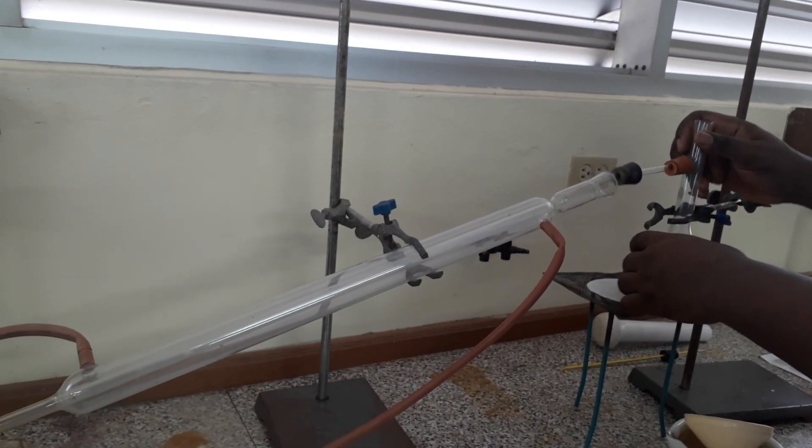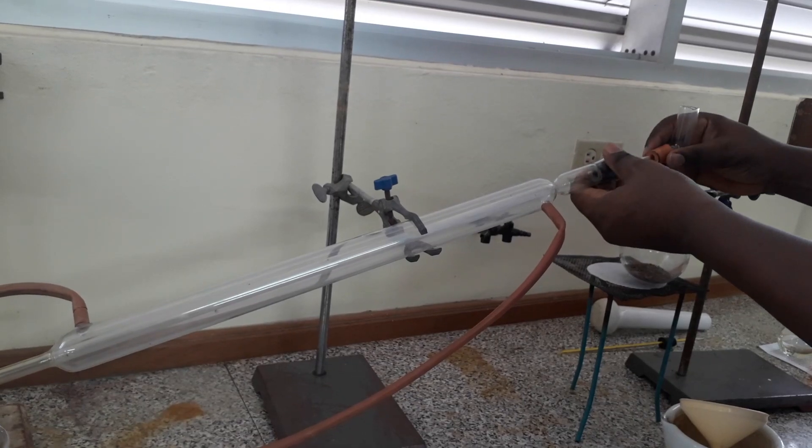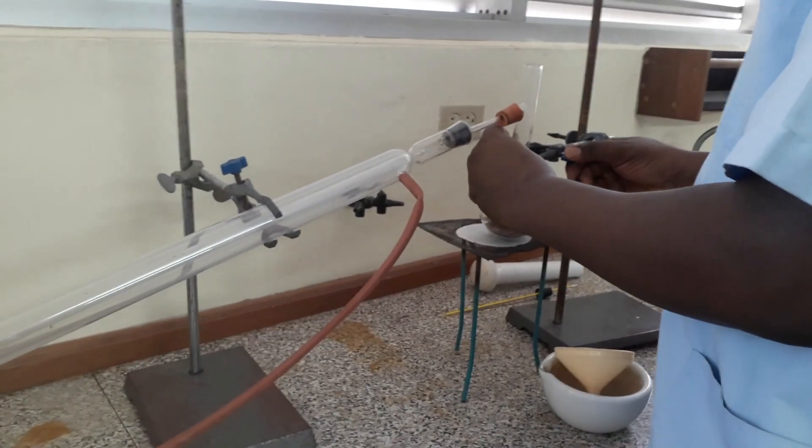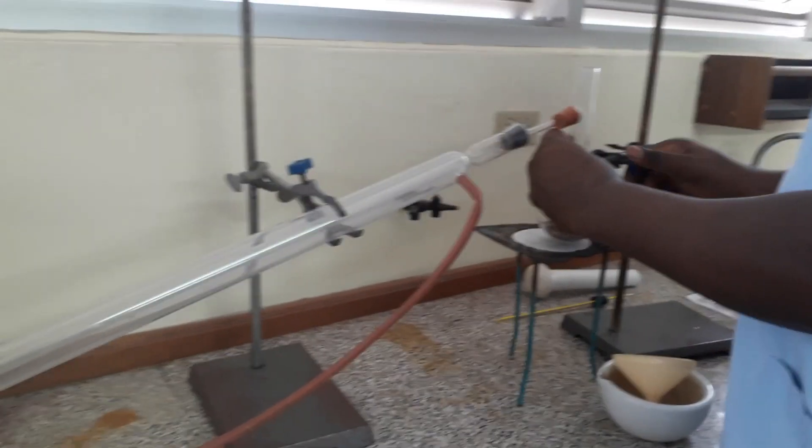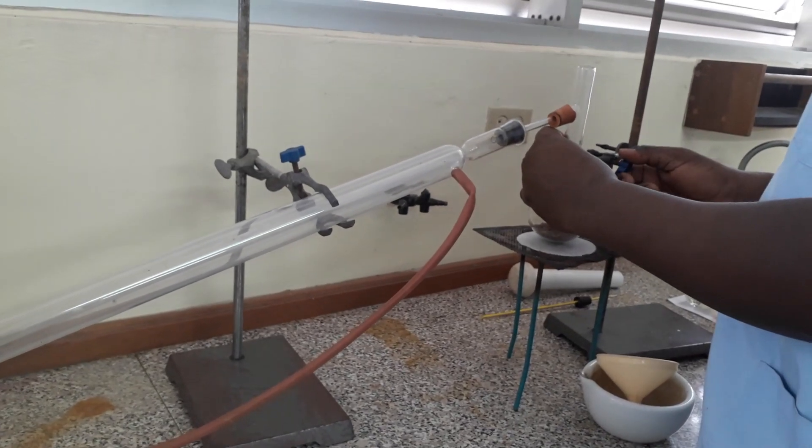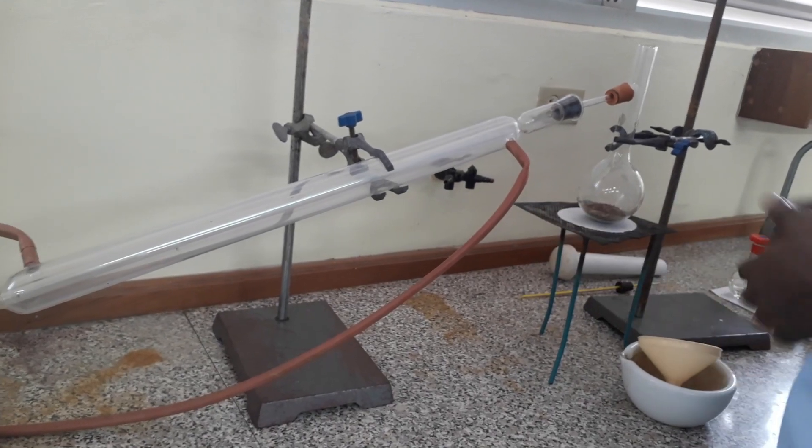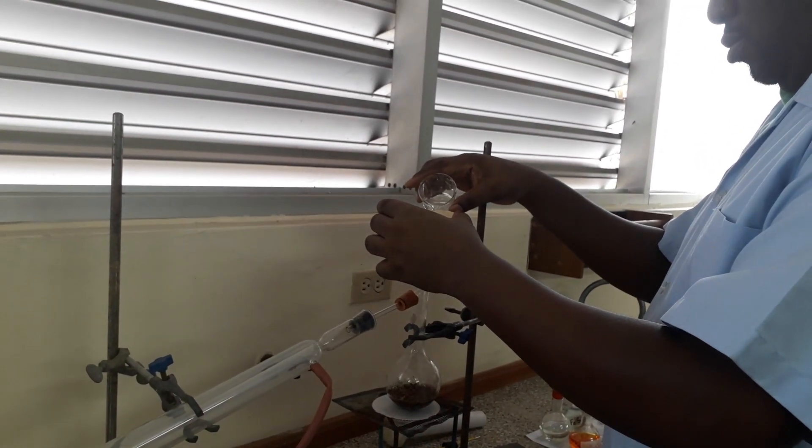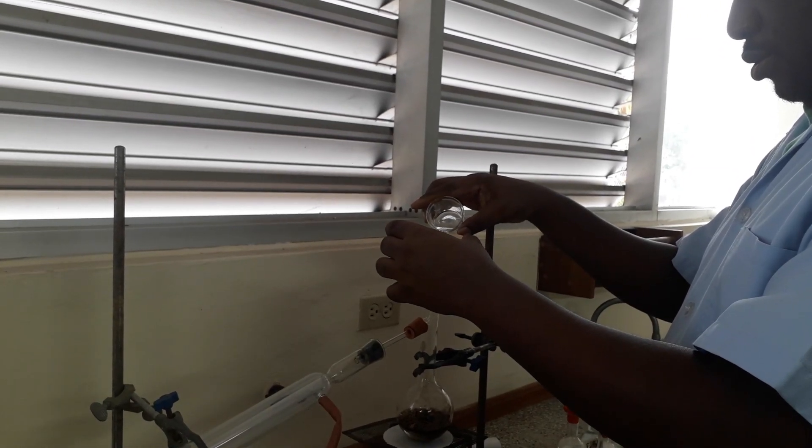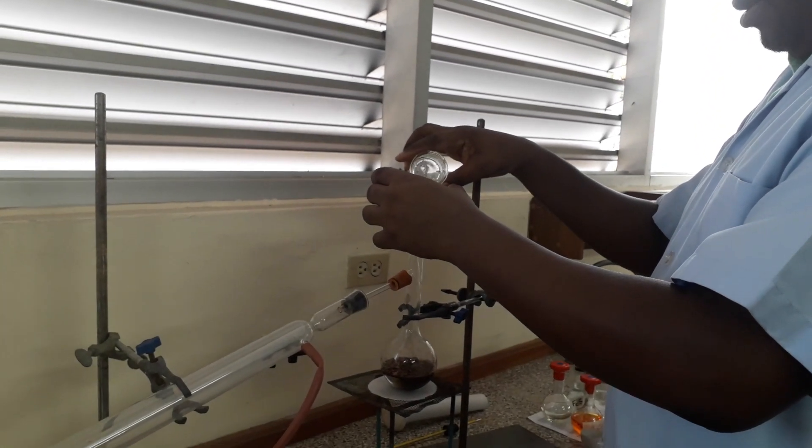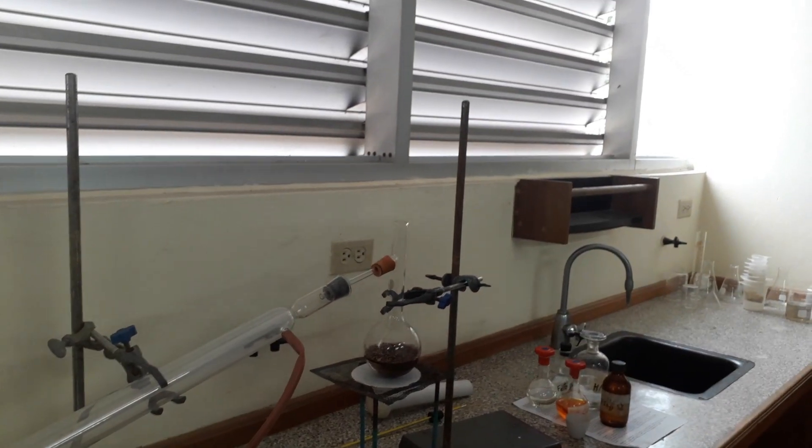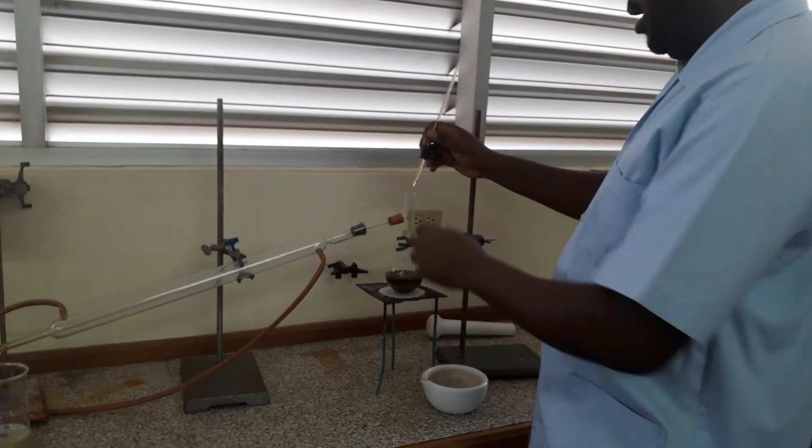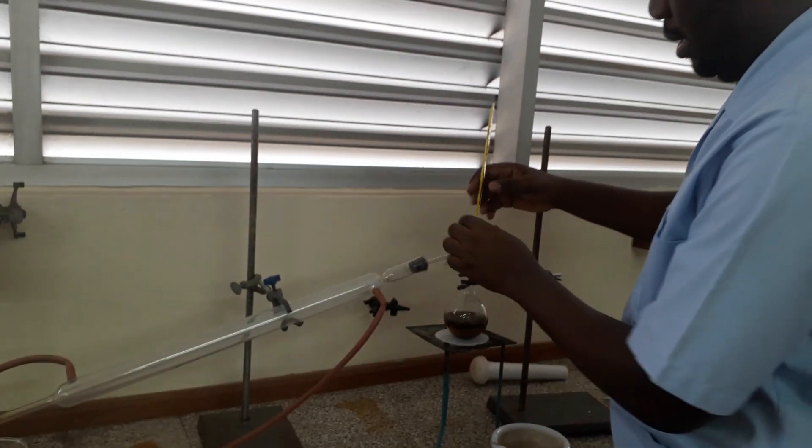I'm going to put this back here, reattach, make sure the fittings are tightly held into place. We're going to have lots of material when the boiling takes place. So I'm going to add some water. I'm going to allow that to sit for about 15 minutes, so it can be properly wetted by the water.